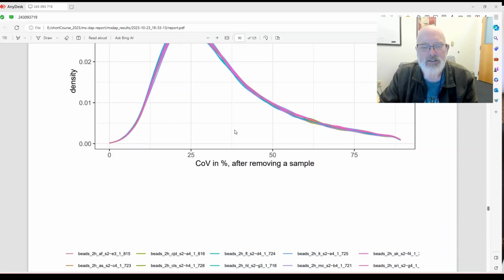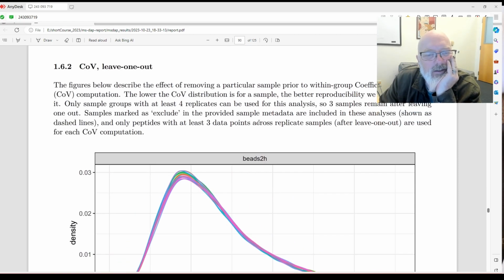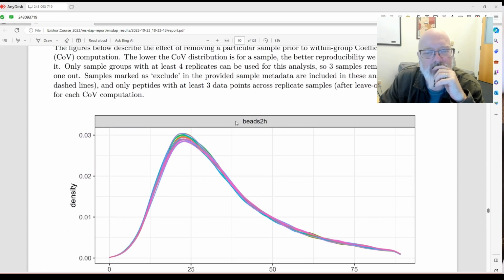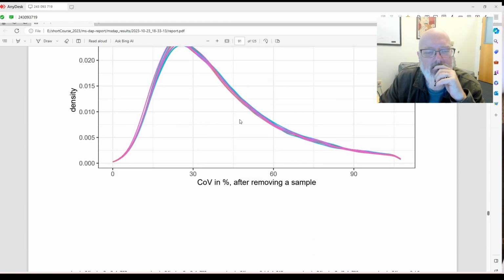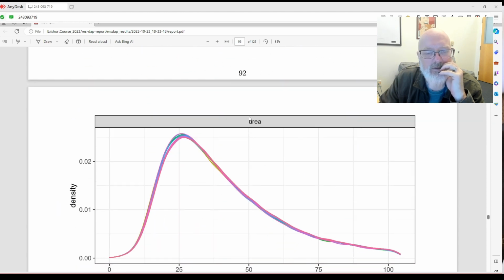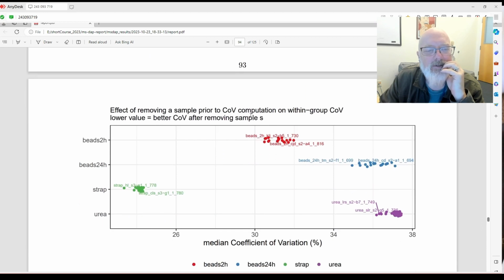I am not sure. So beads 2 hours after removing a sample, but I don't know where it says the sample's removed. Only peptides with at least 3 data points. I mean, that's pretty cool. I wish I could figure out which one it removed. After removing a sample. Okay, but which sample is removed? It must be somewhere, right? I don't know. I don't see any dashed samples.